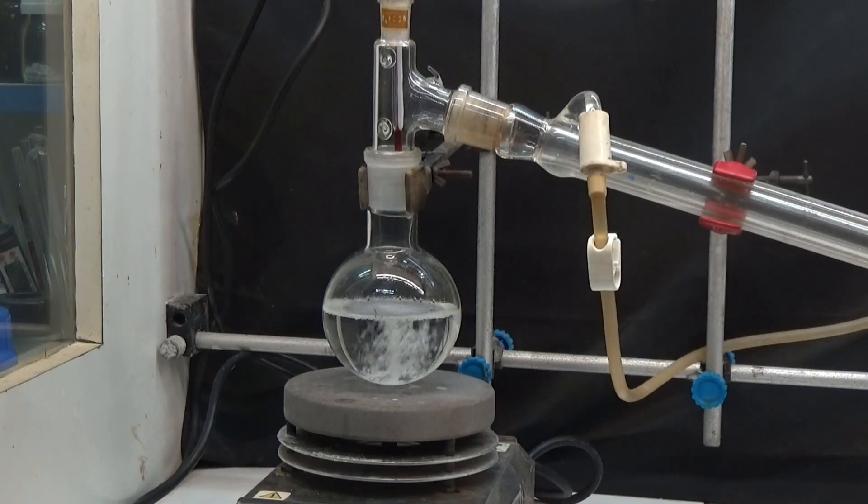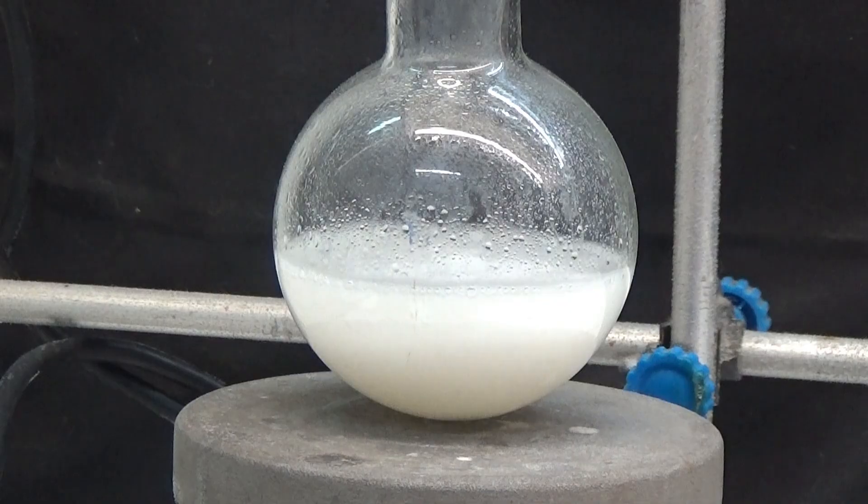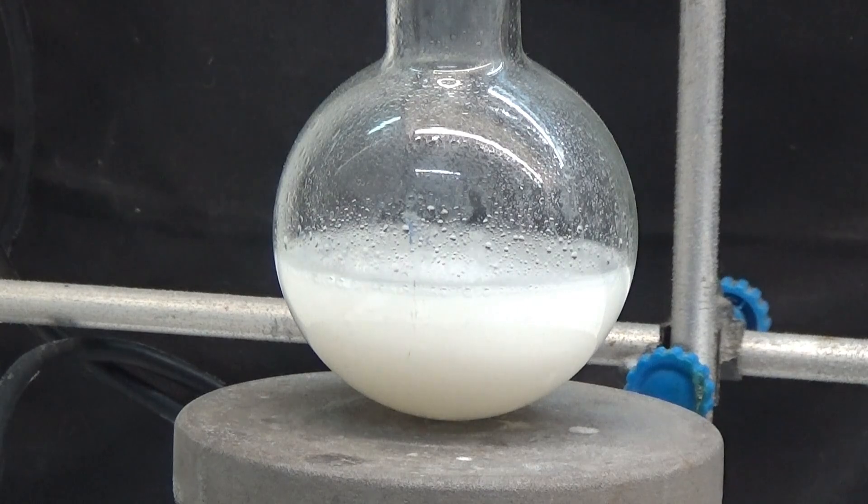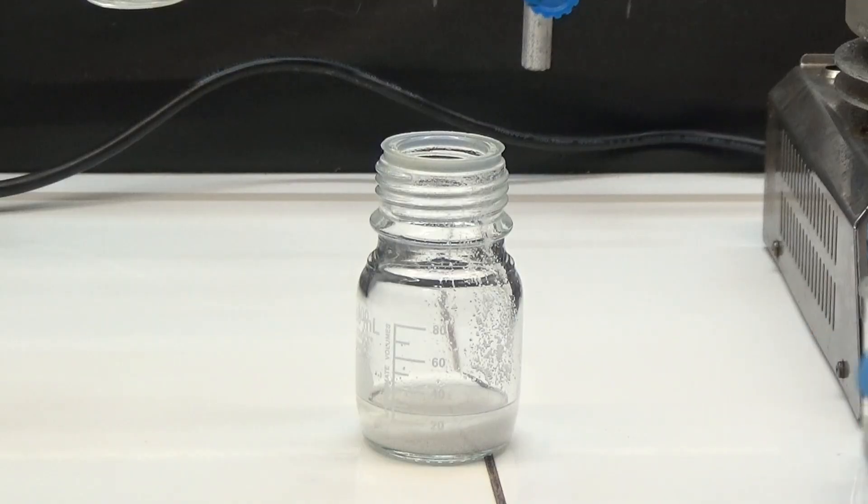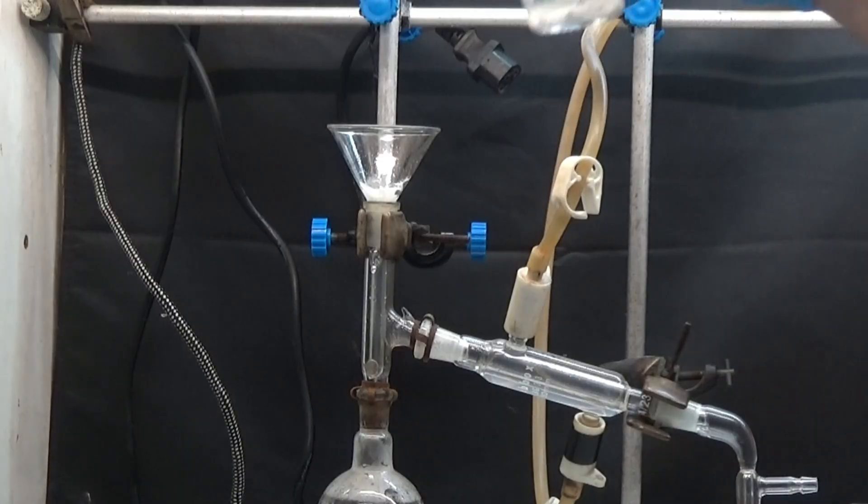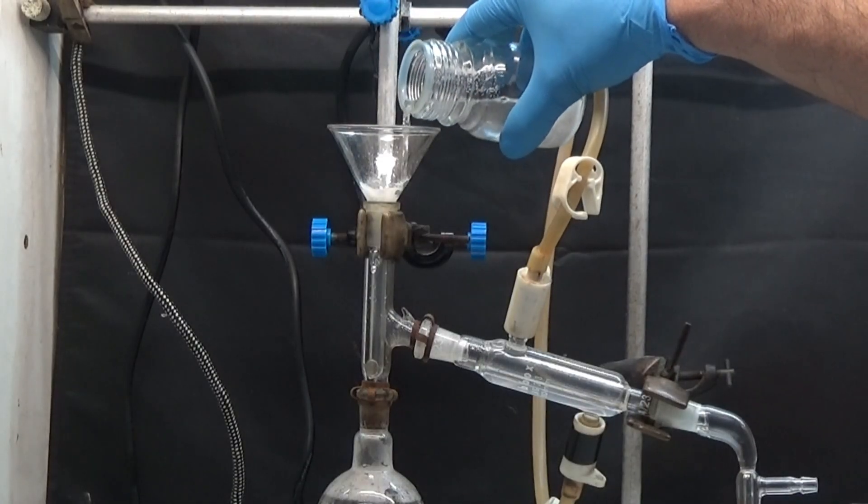We operate the same as before. Distill the ethanol until it is complete, and neutralize it twice with 50ml of concentrated sodium hydrogen carbonate solution. Dry with anhydrous magnesium sulfate and filter. Wash the desiccant with a small amount of ether and filter everything into a distillation flask.